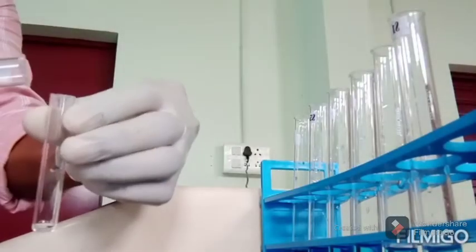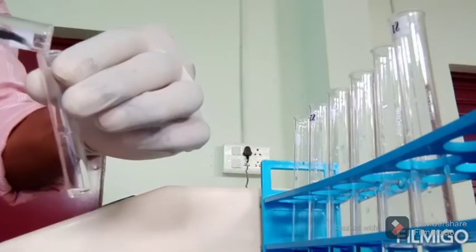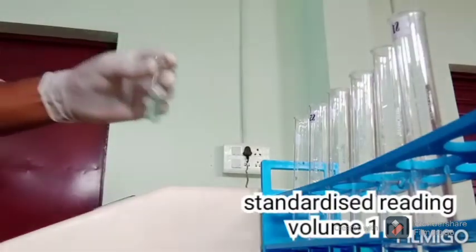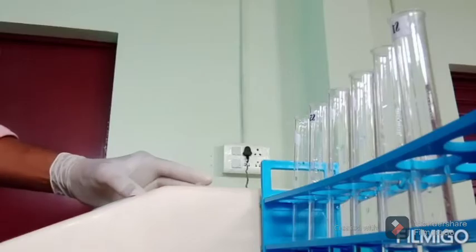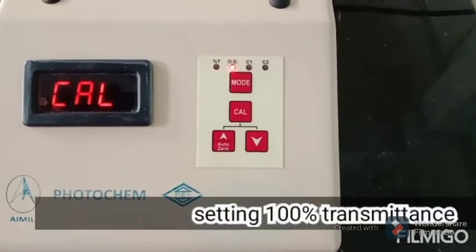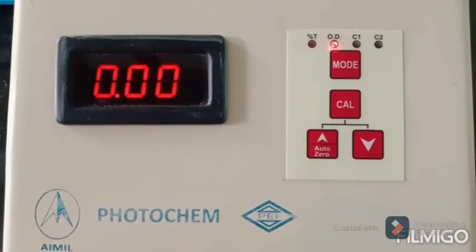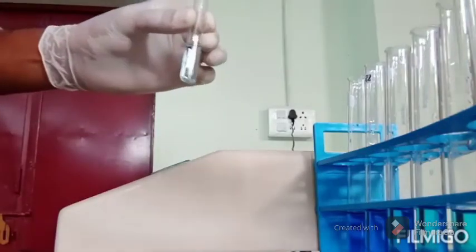Now we can proceed with the zero setting using blank solution. 1 ml of blank is transferred to a dry, clean cuvette, and this is to be read and made zero by pressing the press button on the colorimeter. Now blanking is done to cancel out the OD contributed by other reagents involved in the experiments. So blank is also called a reference solution, so it avoids the interference of other reagents. Now the zero is set.